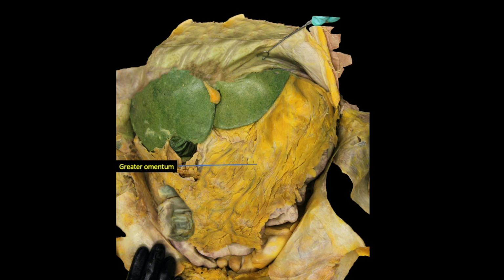In fact, part of the reason that the abdomen dissection is difficult to initiate is due to the likely adhesions of the greater omentum to the anterior abdominal wall and to the organs of the abdomen as a result of the omentum trying to fight off infection during the cadaver's lifetime. Once these adhesions form, they are further exacerbated by the embalming solution applied to the cadaver.